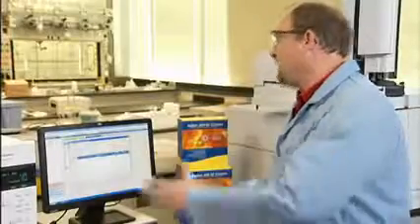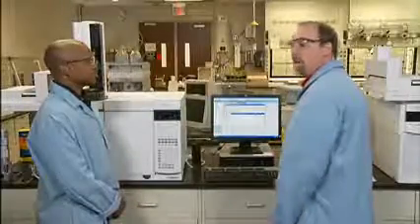And that'll go all the way up to the top. In fact, it'll even affect the pressure that I'm using to drive that flow so that I got the same flow rate as I used to have. But as you know, Herb, the best way to verify that you have the right flow rate, whether you have an EPC or not, is to inject something of known retention at a given temperature and make sure it comes out at the right retention time. Usually an early eluting peak is the best choice. The old school method is still the most reliable.